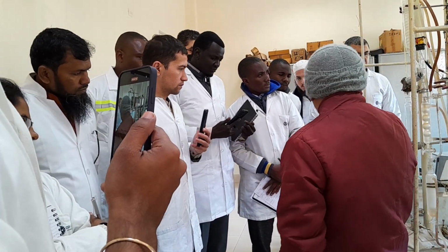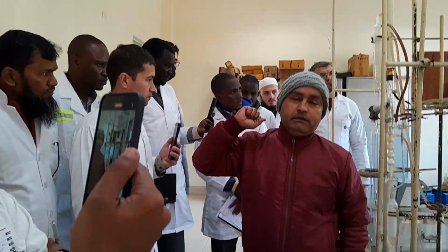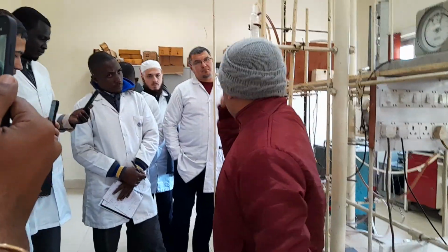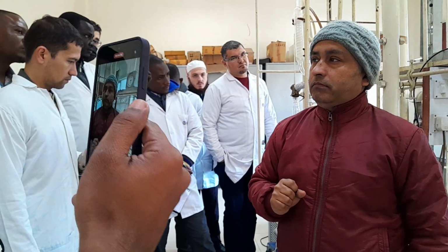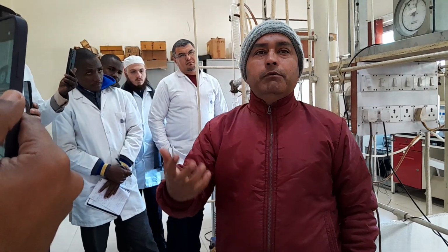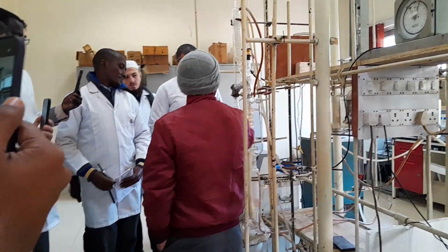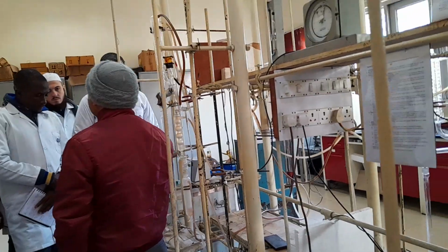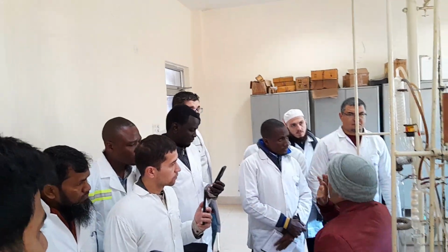Now, in the dehydration process, you will have to keep your condenser at minus 20 degrees centigrade. Why? Because as we know, at minus 20 degrees centigrade, my C1 to C4 will remain in vapor form. That is also known as LPG potential, or you can say the debutanization of the crude oil. So I will maintain my condenser at minus 20 degrees centigrade. There is crude oil, you will have to heat it up gradually, and as we know that at minus 20 degrees centigrade, your C1 to C4 will be in vapor form.